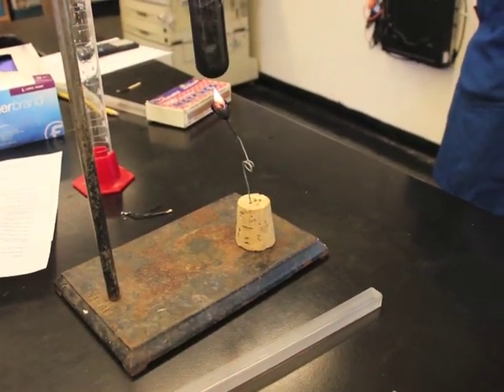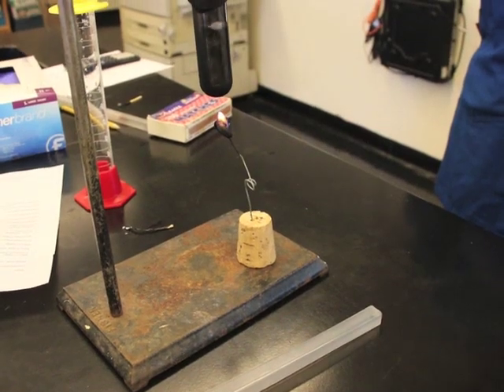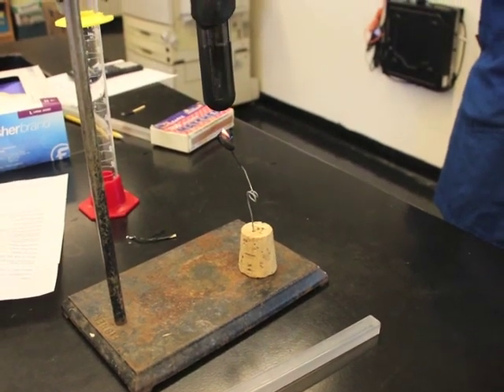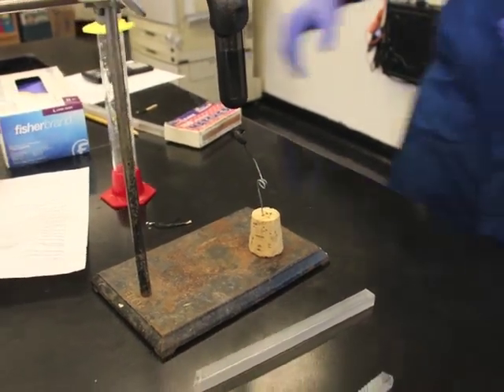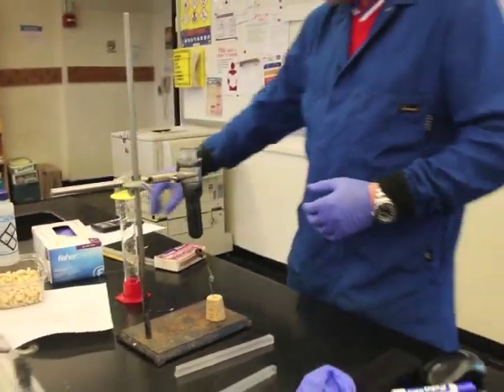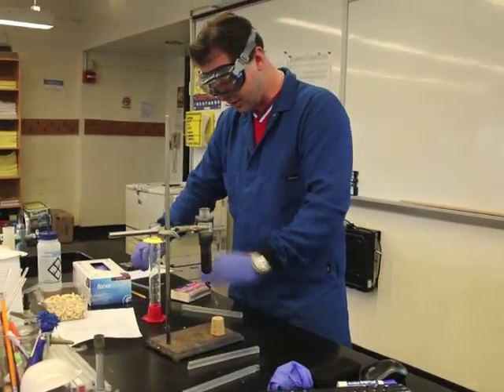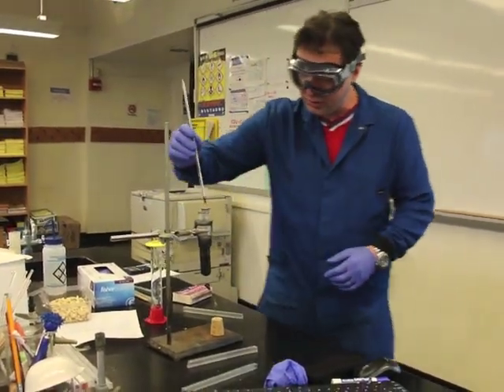As you can see, our water is boiling, so I'm pretty sure the temperature of this water has to be 100 degrees, but we're going to measure it now because once it's finished it's stopped.